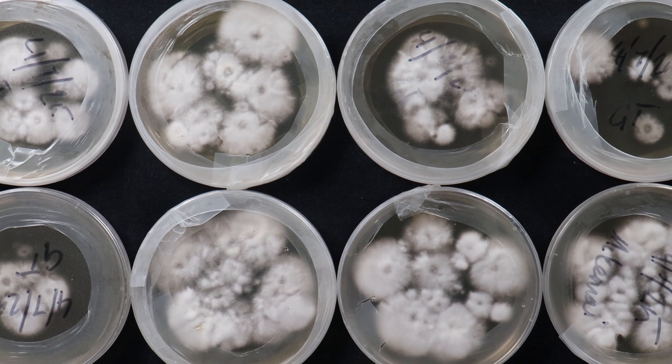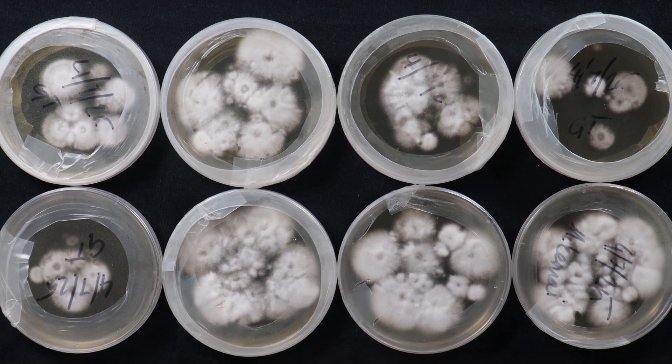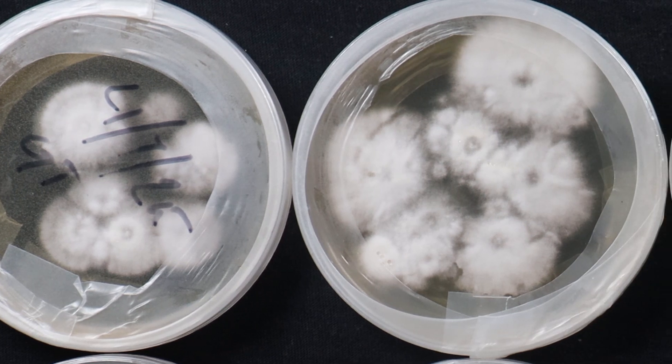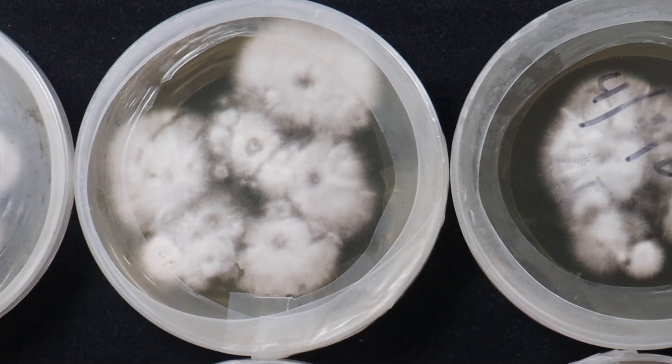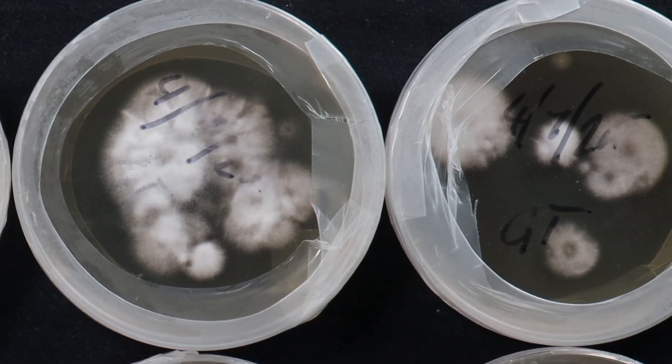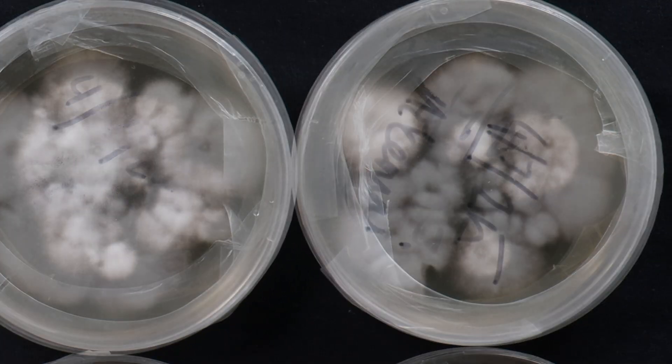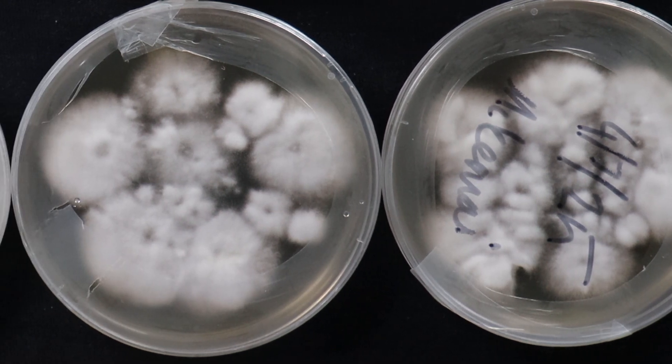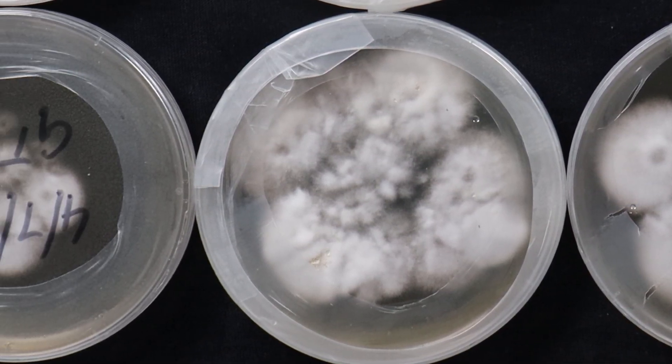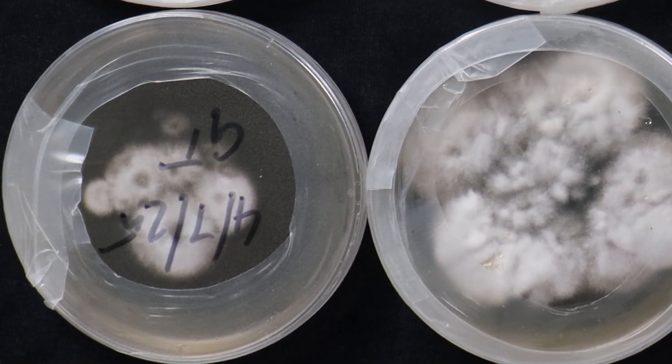Now let's see how they look after about two weeks. And my goodness, they're really starting to take off. You can see each individual colony is expanding outwards and meeting up with some of the other colonies there. I'm really excited to isolate some of these different cultures and get them into some grains and fruit some mushrooms. Fantastic.